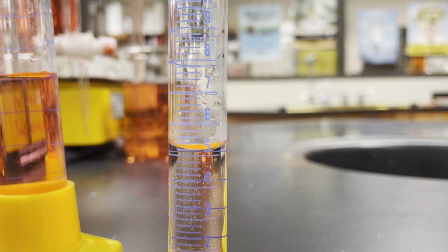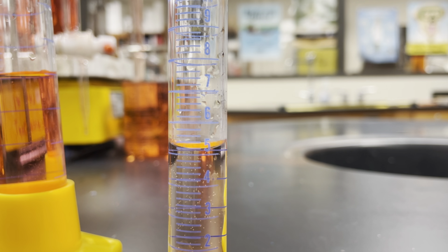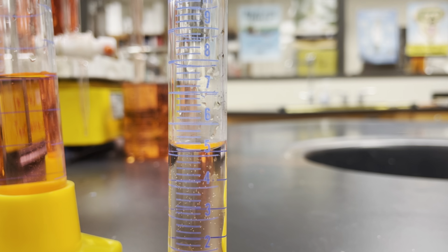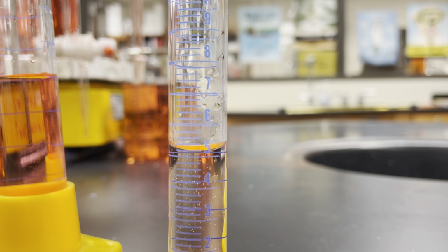Okay, now I know for sure that that is the 5.2 line. And the one above it would have to be the 5.4 line. Now in between that, I could say that could be 5.3, but could I say it's 5.35? That's kind of stretching it a little bit.